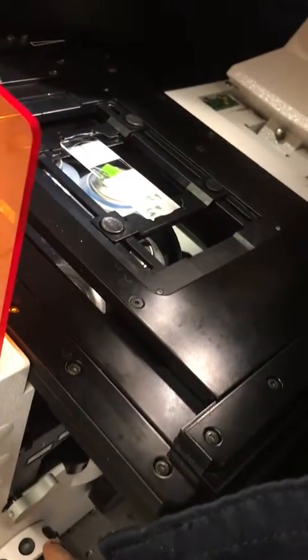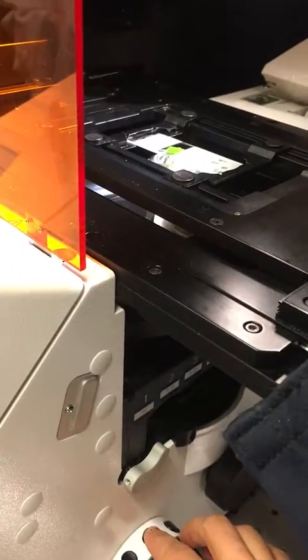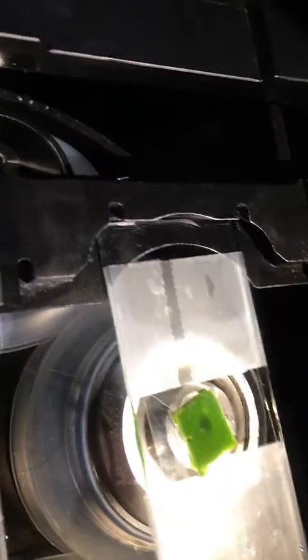Instead of smearing the immersion, I can just ask the lens to go a little bit down to load position. Now it's not touching my sample, and I can move the stage with the joystick until my piece of leaf is placed right above the lens. Then I can click on the work position, and the lens will go up. You can see now it's touching the sample, and now it's ready to scan.